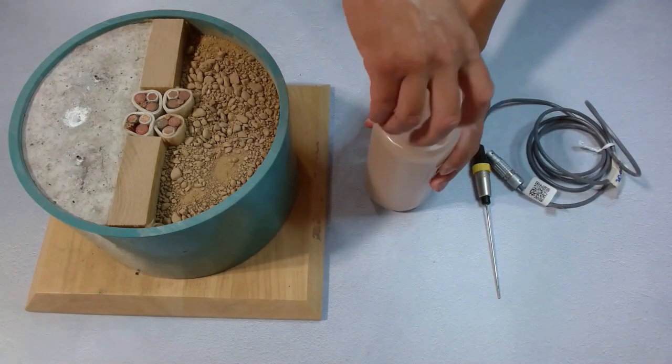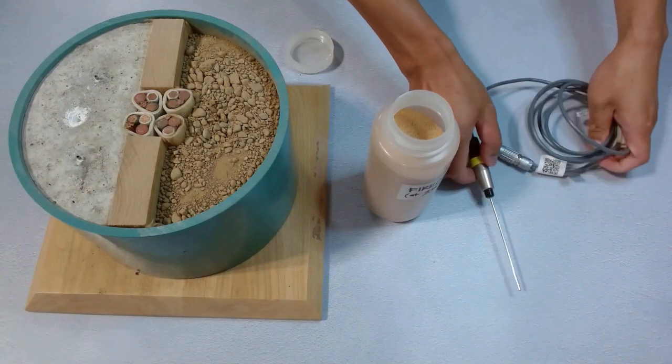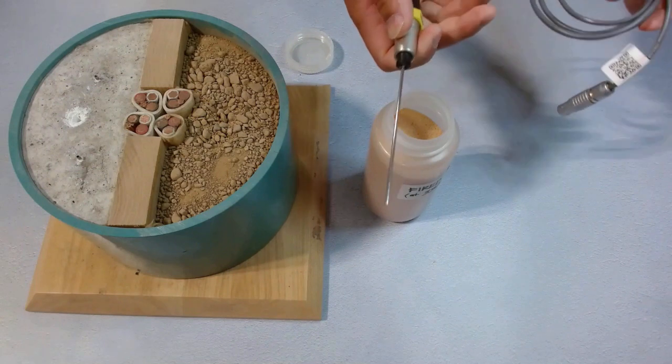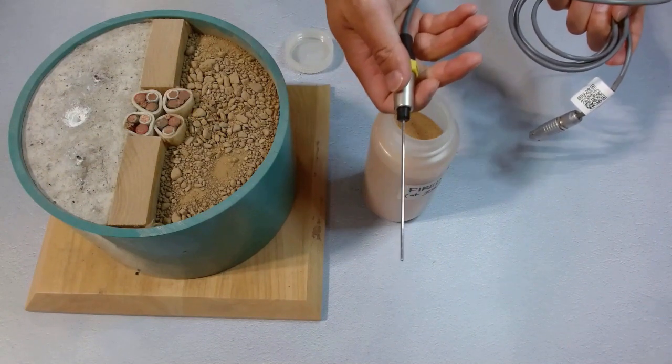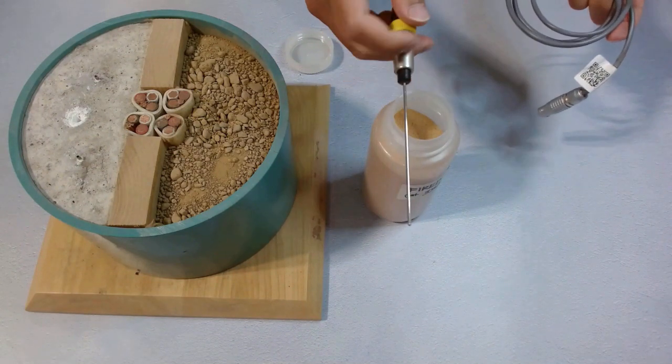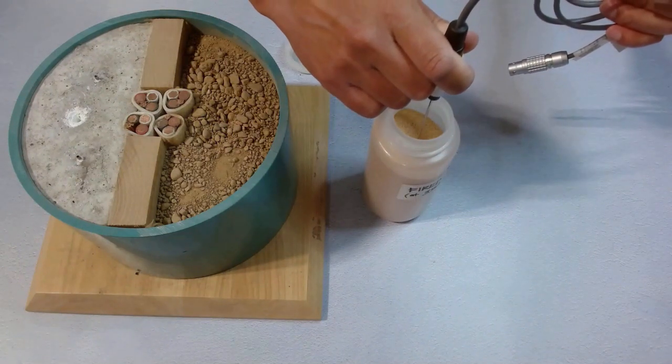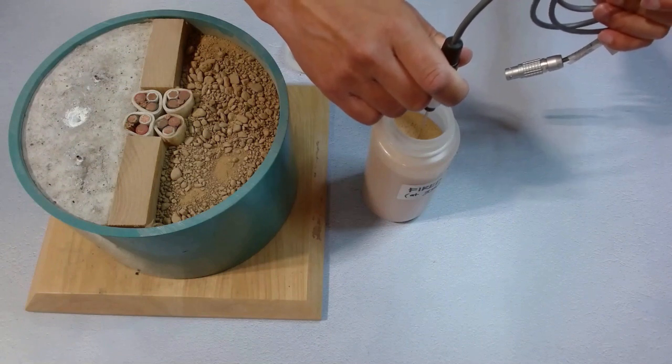We remove the cap and take the needle. Always handle the needle by the metal handle. Never pull the cable and try not to touch the needle tube. We dip the needle into the sand straight and slowly.